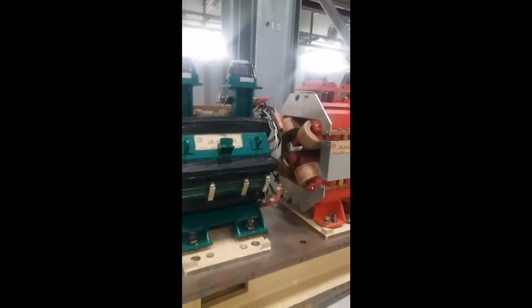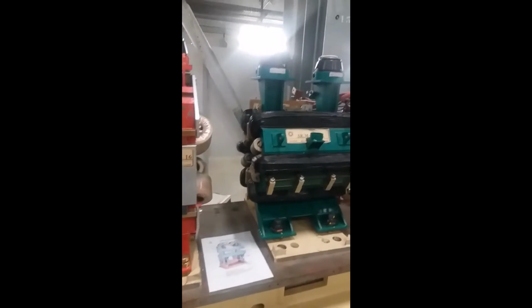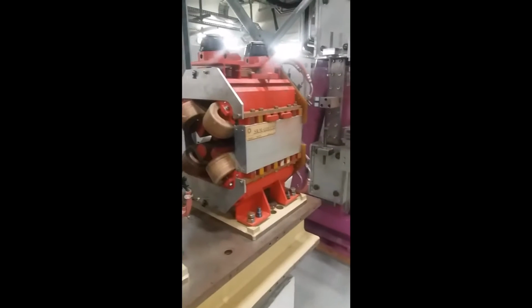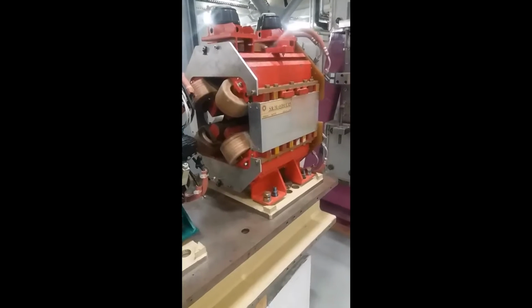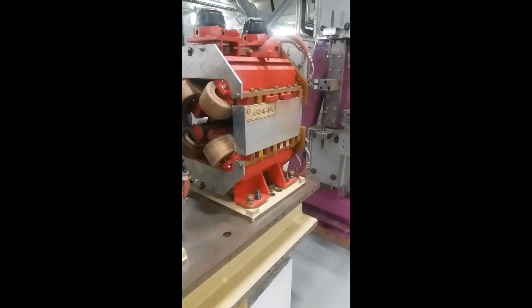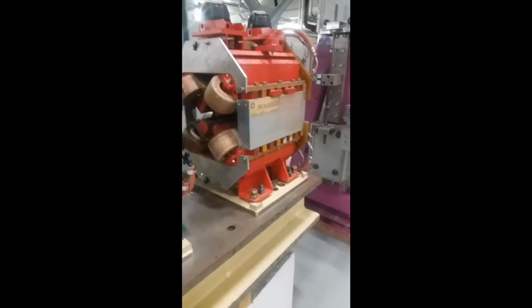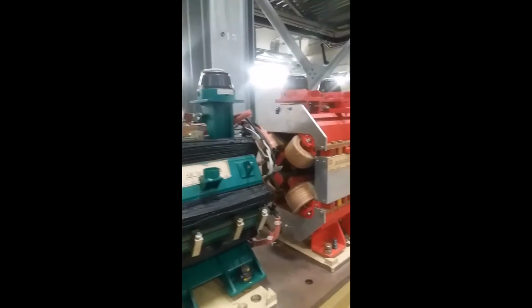We can see a succession of quadrupoles and hexapoles that were basically the focusing elements, the elements that are supposed to condense the electron beam in order to reduce as much as possible its size, and then increase the brilliance.